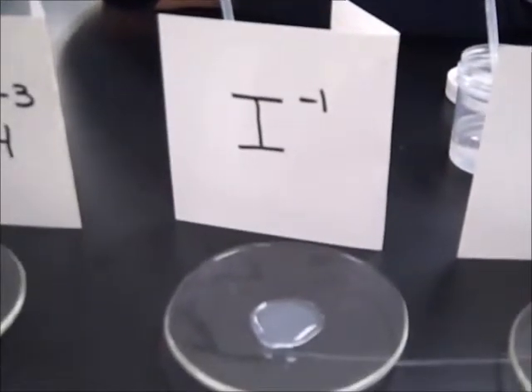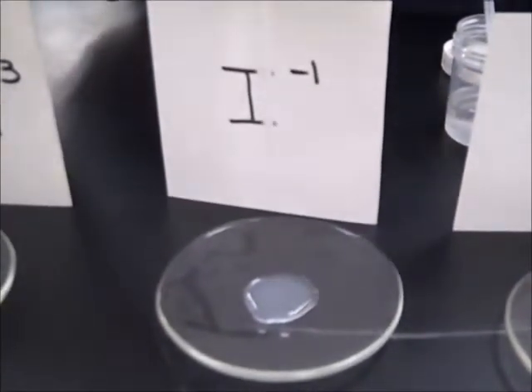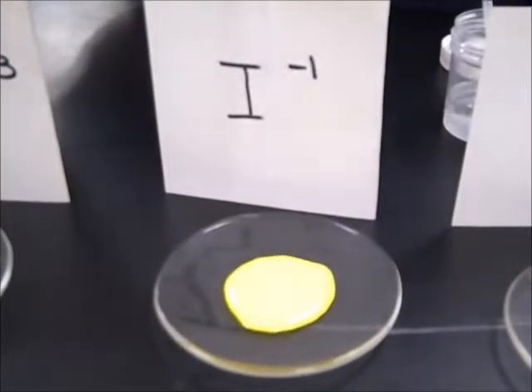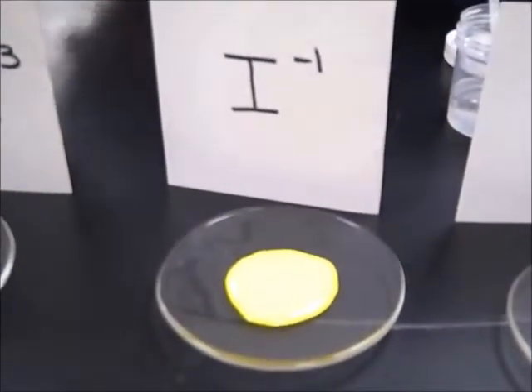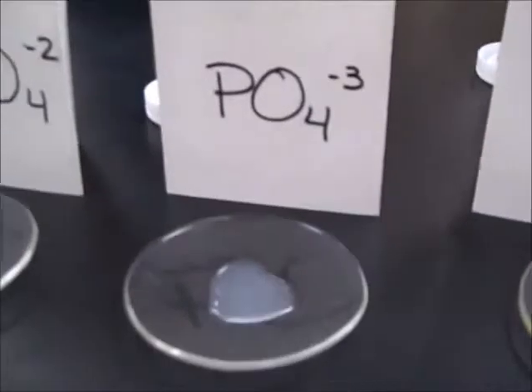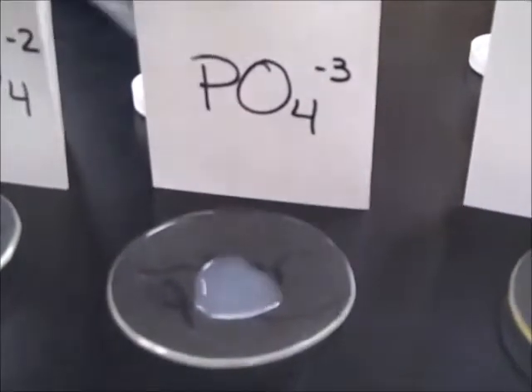And the next one is the lead and the iodide, the I minus. Ooh, paint. Don't drink this. All right, your turn. Yeah, don't drink that. Yes, it is my turn. It's a little too yellow for mustard, I think. Yeah.